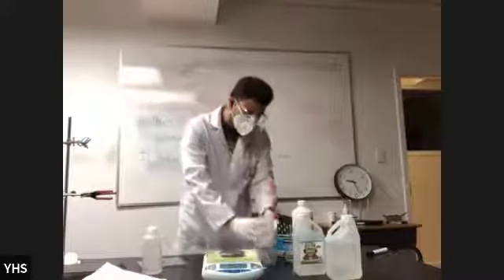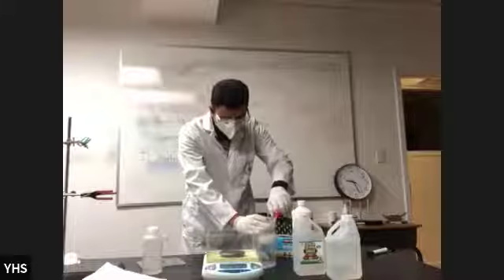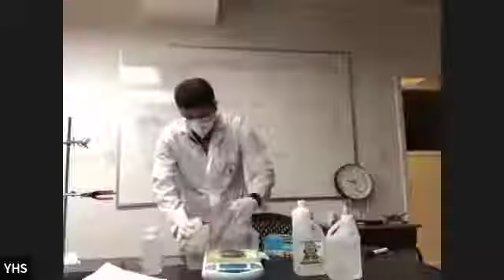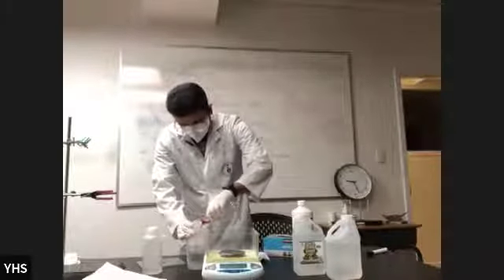Okay, I'll just have to wait because there's a lot of foam coming out. A little more. Okay, more foam coming out. All right, a little more, and I think we should be good.